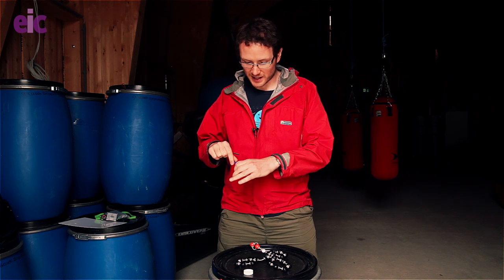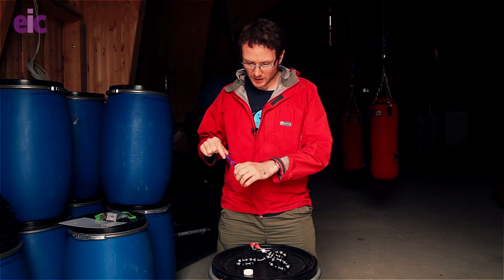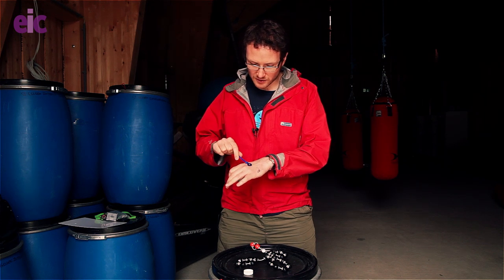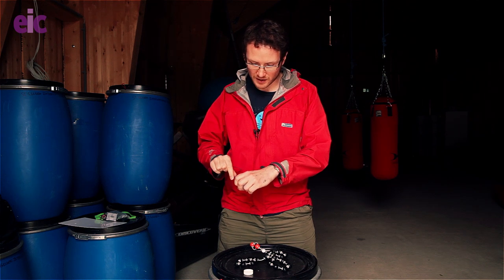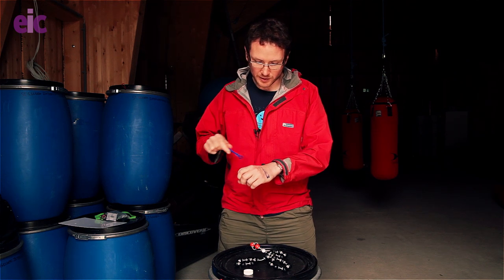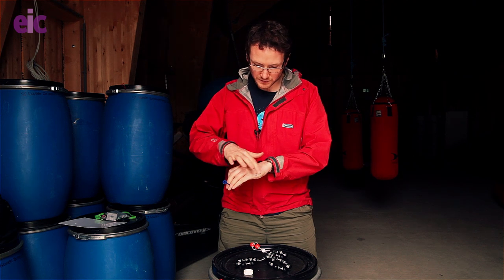I'm just going to stick some on my hands here. You can see that at the beginning it's got a really strong blue colour, which rapidly disappears on exposure to air, or even with a little bit of friction or water — that colour is going to disappear.